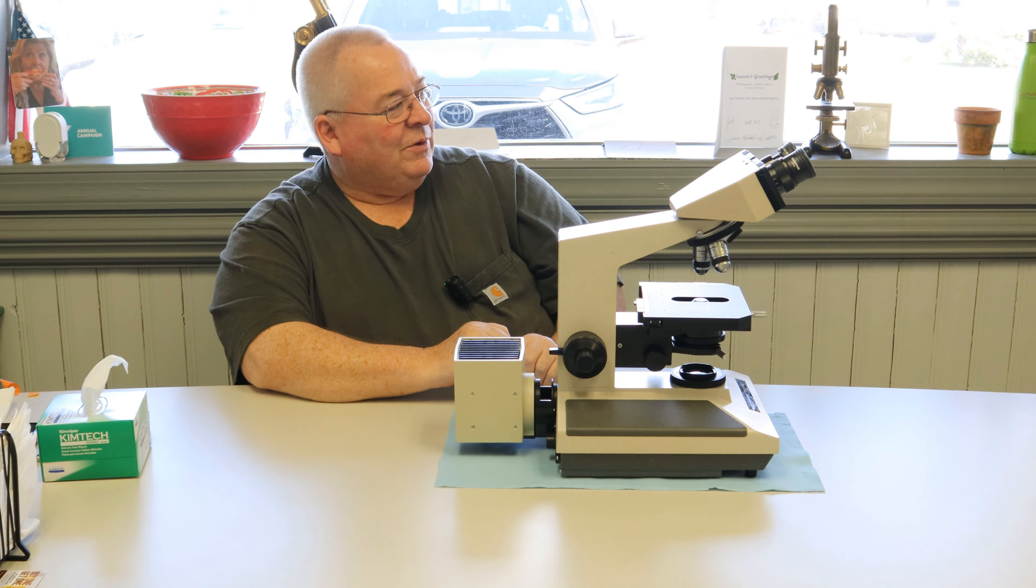Very simple to replace this bulb. You have a bulb lamp housing and a little thumb screw that will take off that bulb lamp housing. You'll see you get to the bulb.